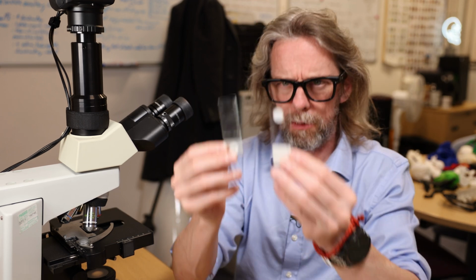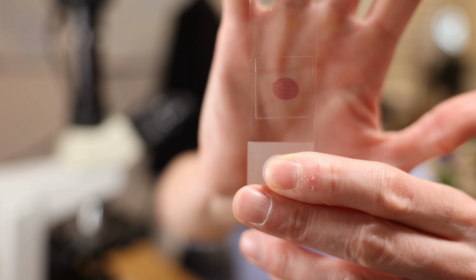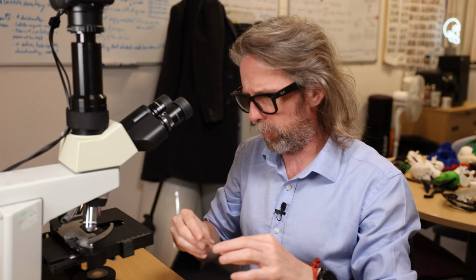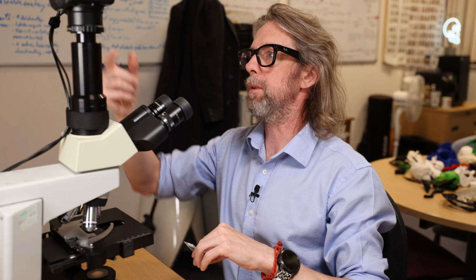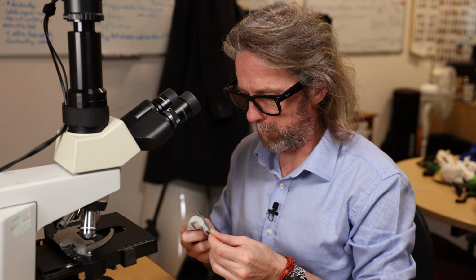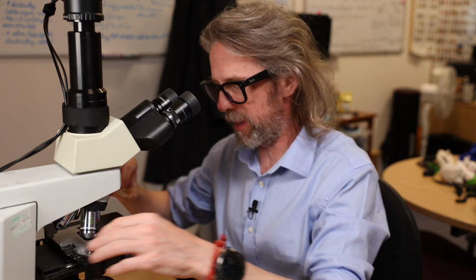These are going to be sections of animal testis. I like the look of this one. This one is darkly staining, and it's ovoid shaped, so I guess that's probably the whole testis, which would be good, right? So if this is good, this is the only slide we'll need to look at. I'm guessing it's testis because... They're lettered, so students don't know what they are. Let's see if I know what it is.